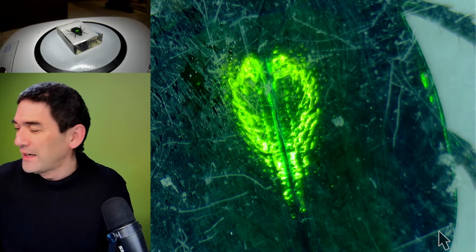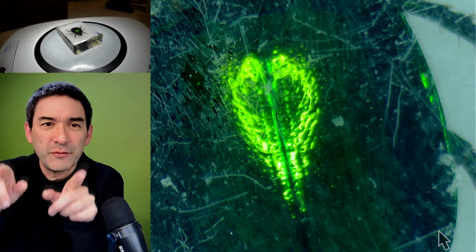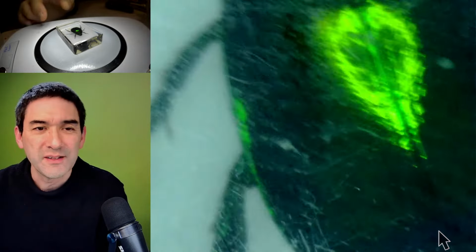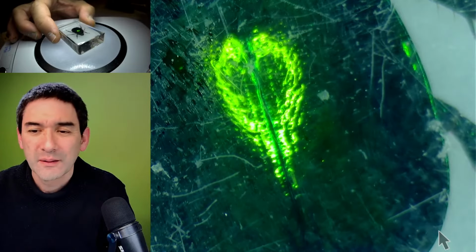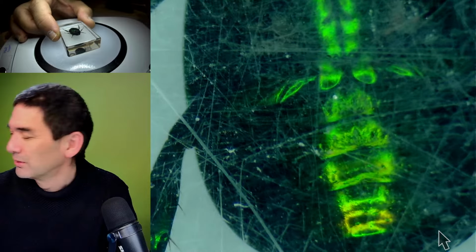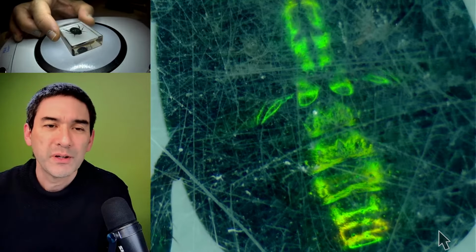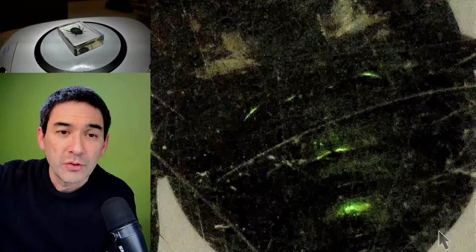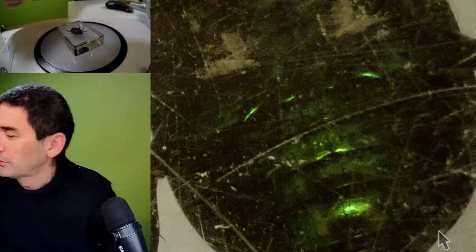That's the ring, from the reflection of the ring light I've got. Yeah, and that's why it looks like this. It's this metallic. Again, turn it around. Wow, look at this, cool. So those bright spots are indeed the metallic reflections of the lamp. You know what, I'm just going to turn it off, and I'm going to turn on the other one.